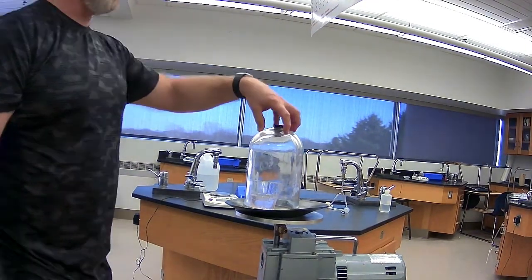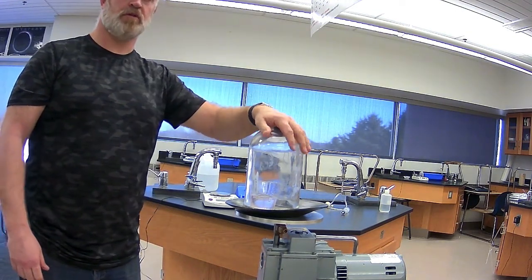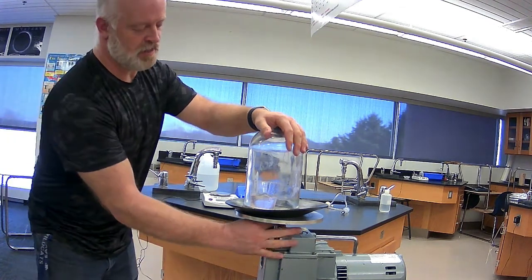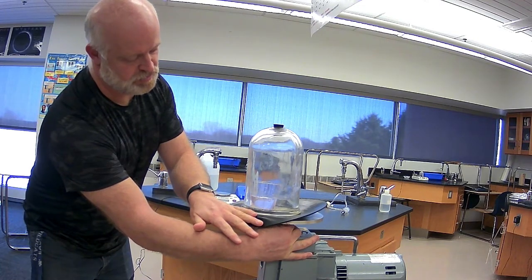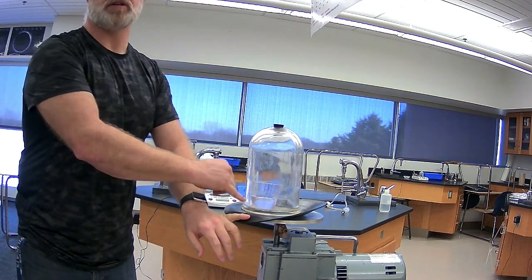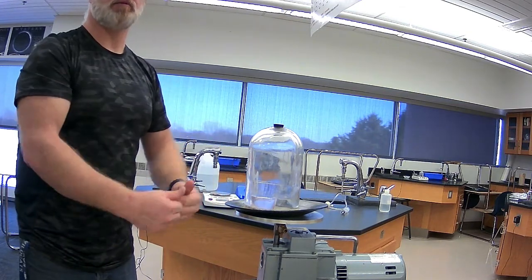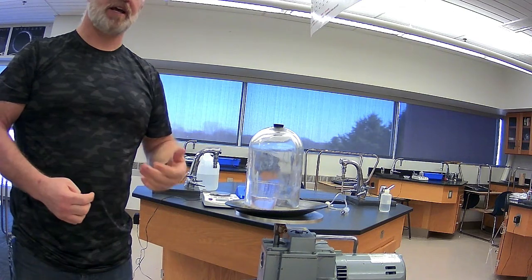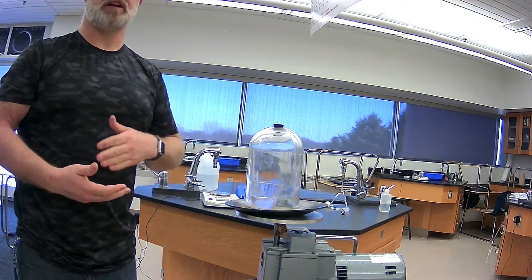From this, we can then go back to what that relationship should be. Looking at that relationship graphically, if we increase the pressure, so if I go now and bring the pressure back, you'll watch, and almost instantly, as soon as I put the pressure back, the bubbling stops. Okay? Because as I brought the pressure up, the solubility of the carbon dioxide gas in that solution increased. So what was there stayed.